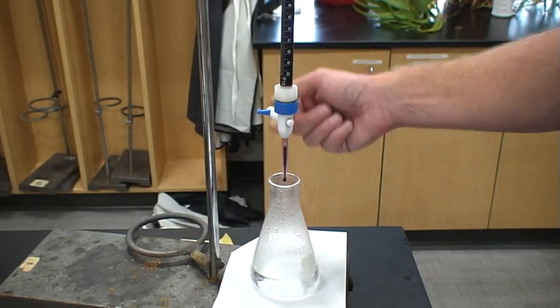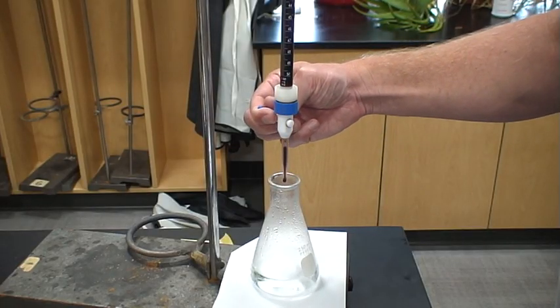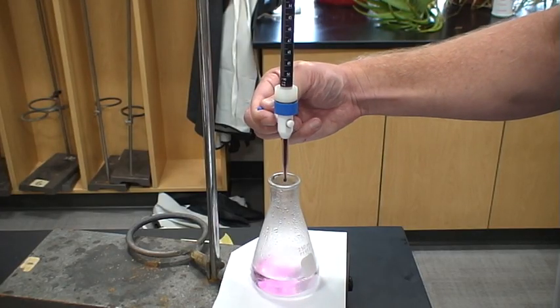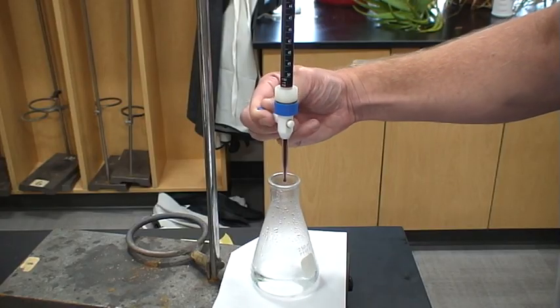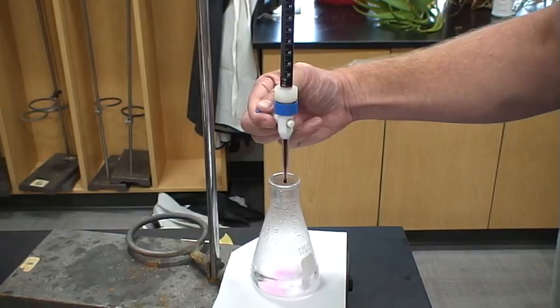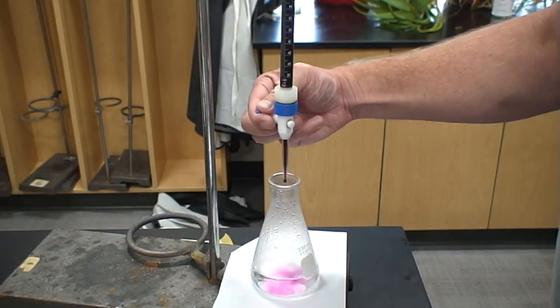And so I'm going to keep on adding this permanganate. I'll know when I've eaten all the permanganates or my oxalates up because that pink will stay behind. Notice that it just disappears. So I'm adding just a little bit at a time. When we get down to the closer part, it'll stay pink for a longer time. And remember, we're looking for 5 seconds. And so I want to keep on adding. As it gets down there, I'm going to get smaller amounts as we go.